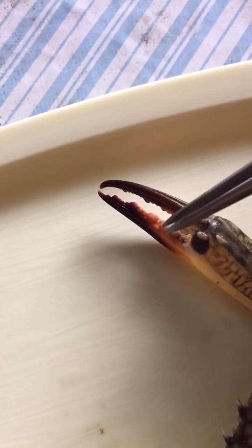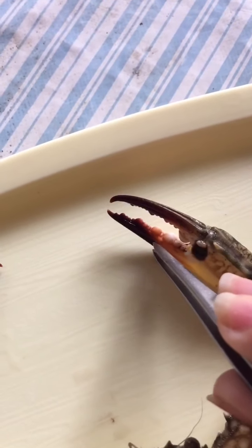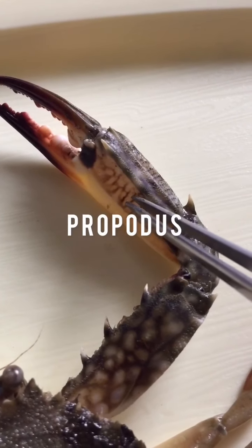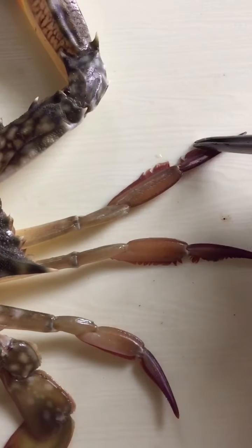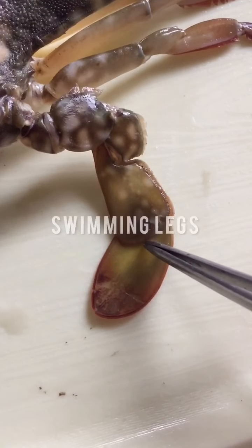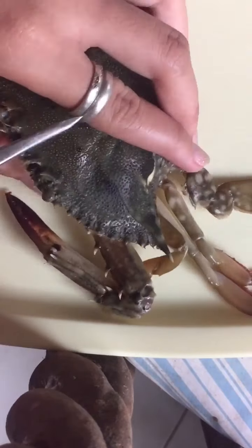The fingers of a crab have segmented parts. First, we have the dactyl, which is the movable finger. The second is the immovable finger. Then we have the propodus, the carpus, and the merus. The crab also has 6 walking legs, basically for walking, and 2 swimming legs, basically for swimming.